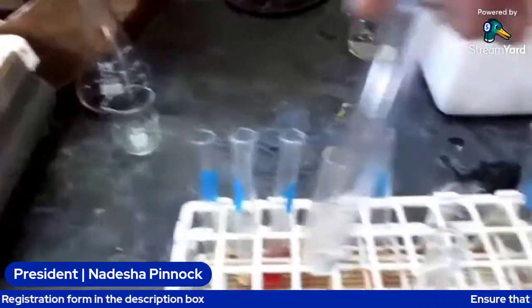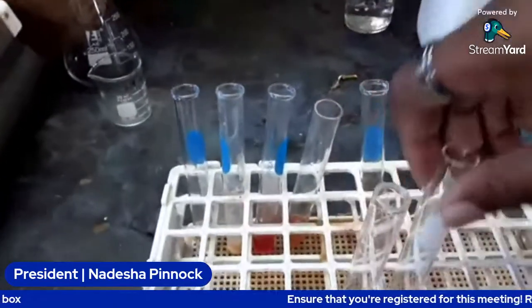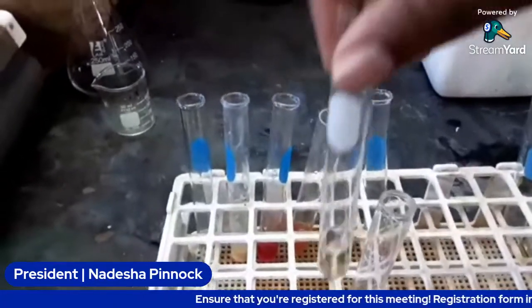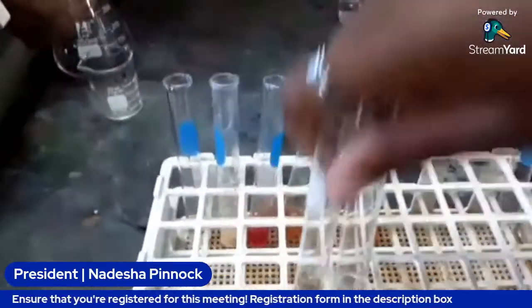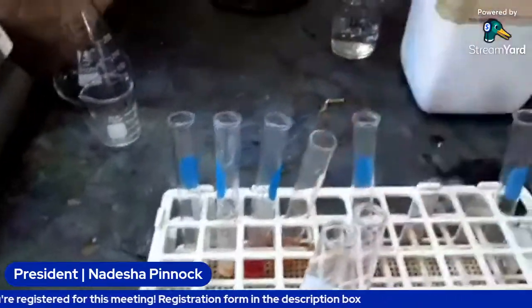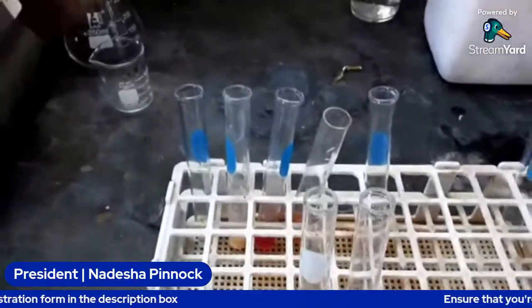So this is our glucose solution that we're going to be using, and this is our sucrose. We're going to do both of them directly with the Benedict reagent.